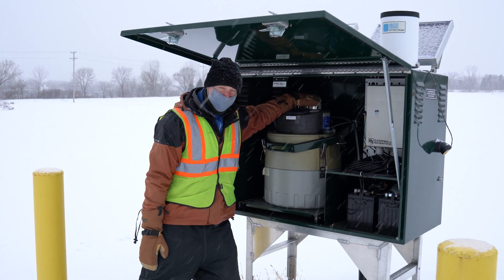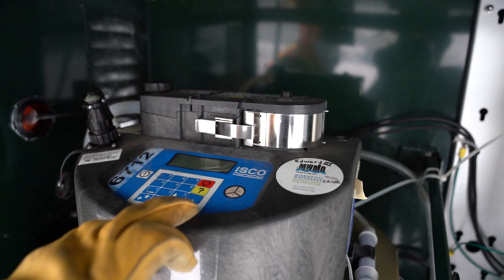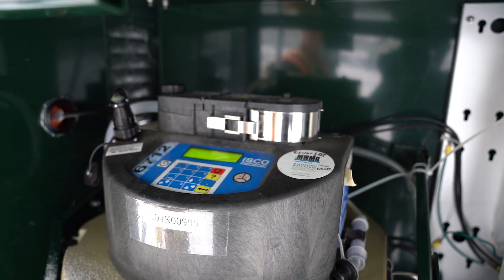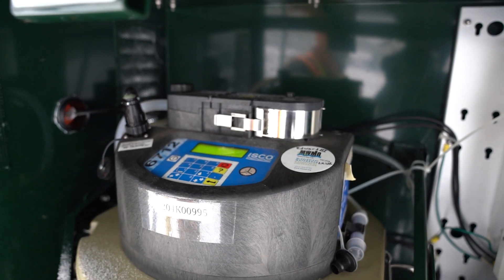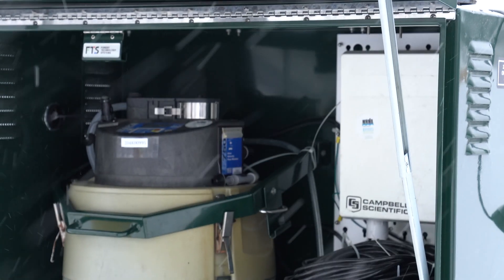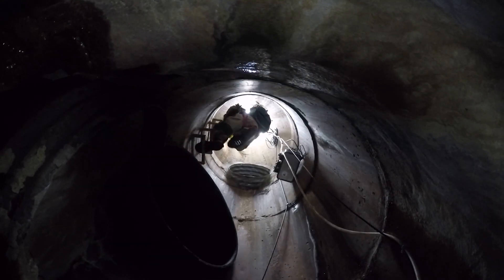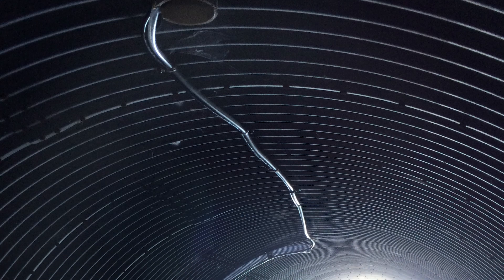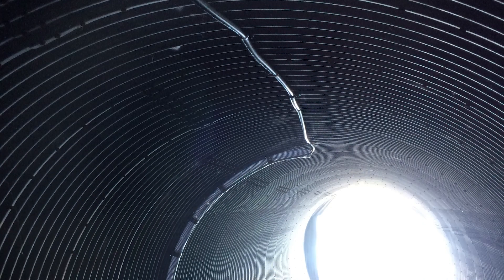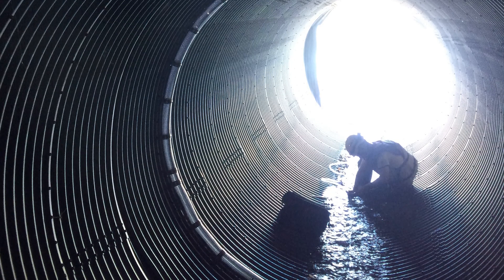The top of this sampler is a pump, and this pump is attached to a suction line, which you can see here. That suction line goes down through the ground about 30 feet to an 8-foot tunnel. That 8-foot tunnel goes to the Mississippi River, so you have to go down about 30 feet and then out to the river is about 600 feet.